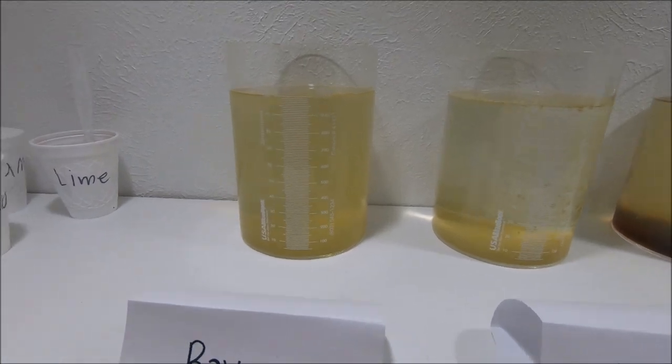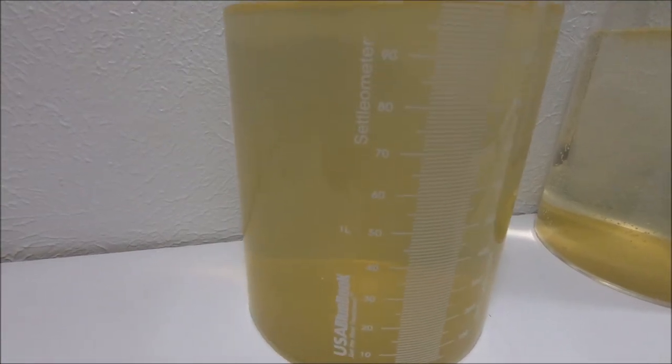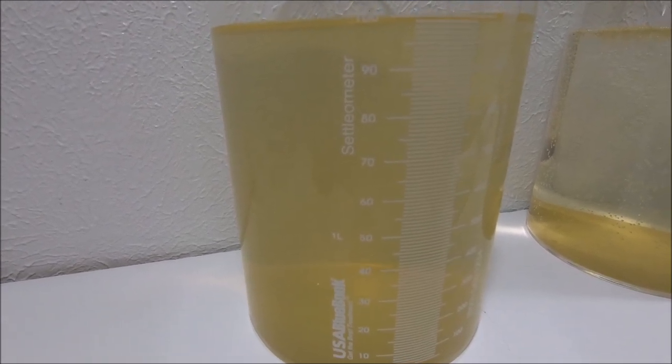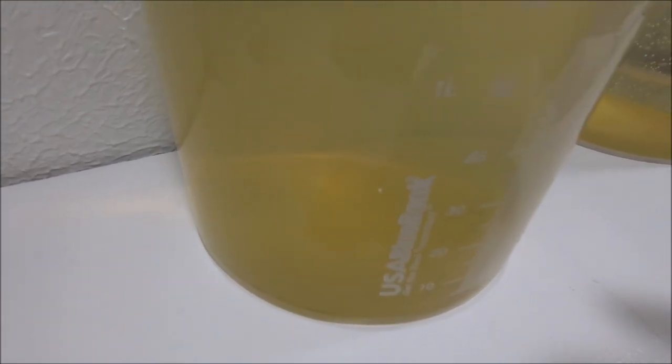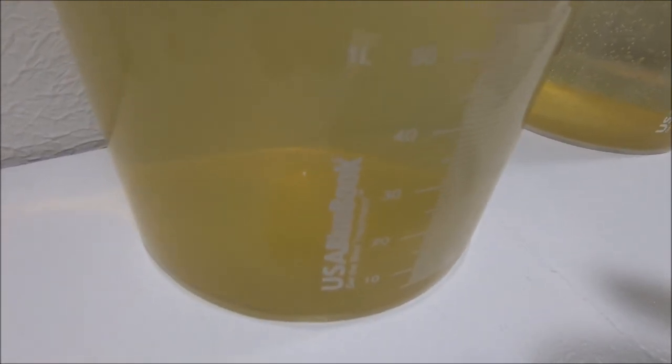Now let's go ahead and check out the raw water real quick. You can see that you can barely tell, but I think it's cleared up a little bit, not much, just a little bit. And you can see at the bottom there's a little bit of sediment. It almost looks like a film on the very bottom of the glass.